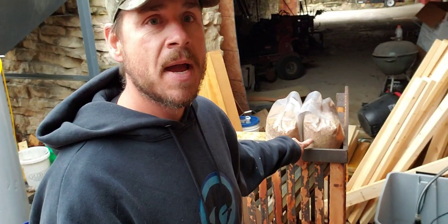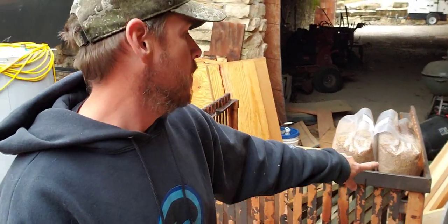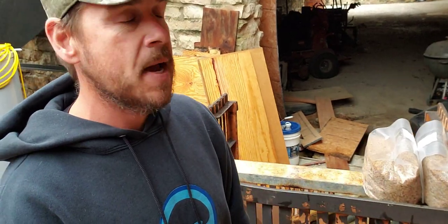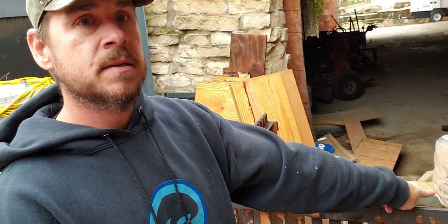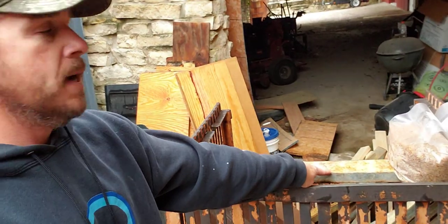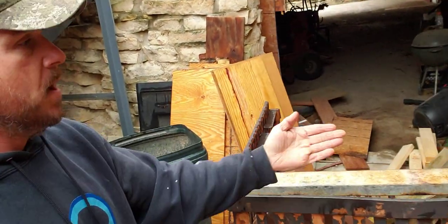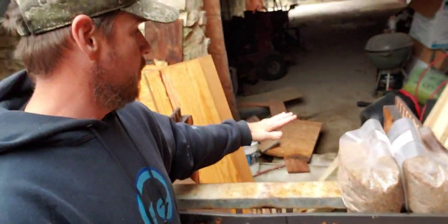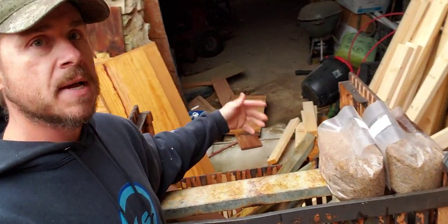This is how my bags are in the autoclave right now. We have two bags, flap to flap — these are three-pound bags. Then I have a space, then two more bags, space, two more bags. So every row has six bags, and then we have multiple rows going down the basket.